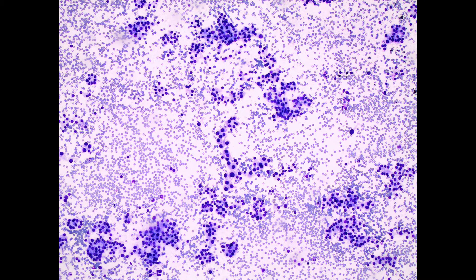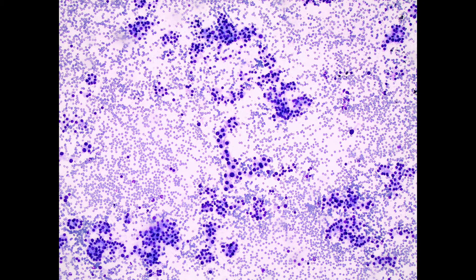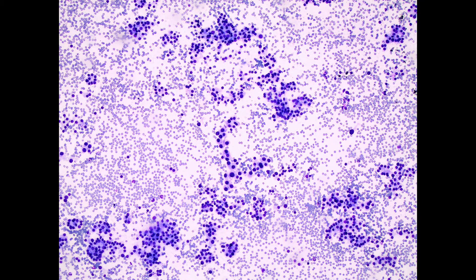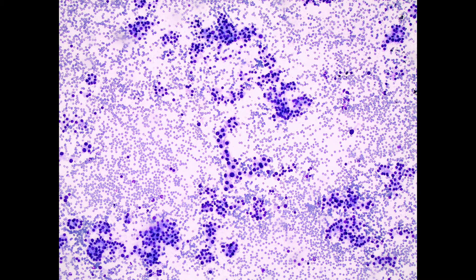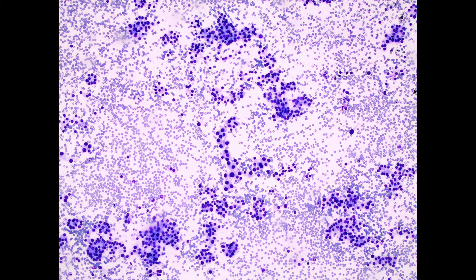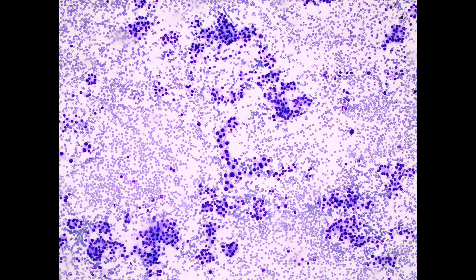The most important feature that should make you think of follicular neoplasm on a cytology specimen is an altered architectural pattern in at least a moderately cellular smear, with absence of colloid in the background.